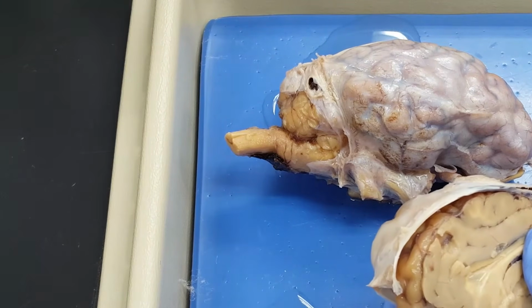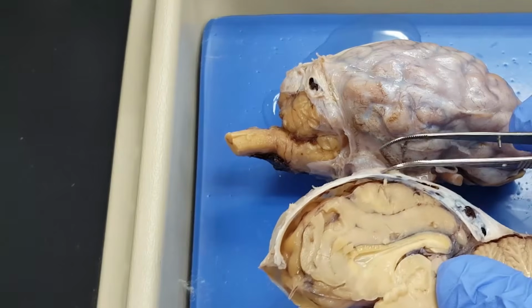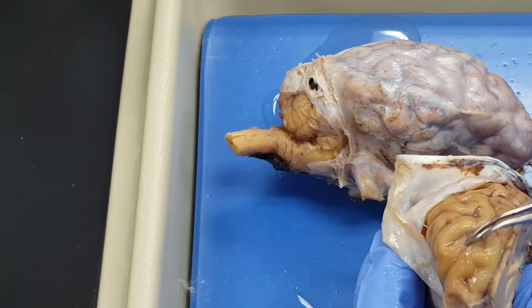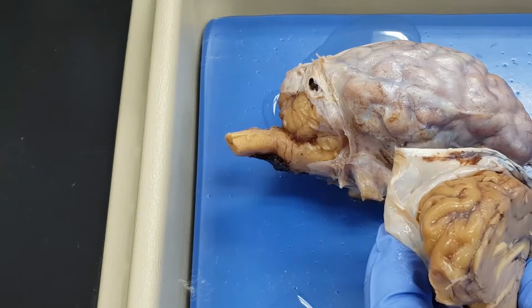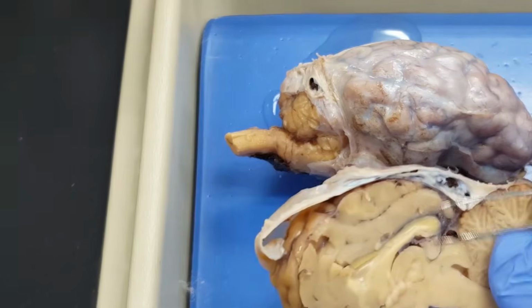In fact, it's one that we see the best on these brains when you pull a brain out that actually has some. I can also see some pia mater, that's this shiny stuff right here. I don't think it's in our list as we go through it. But arachnoid mater, now that usually falls apart very quickly after death and dissection.